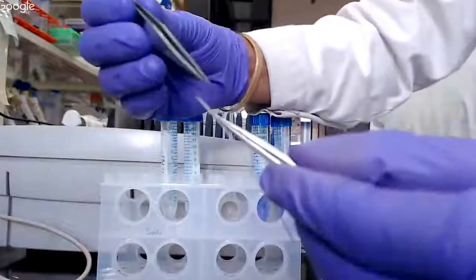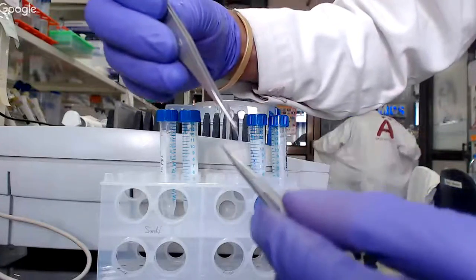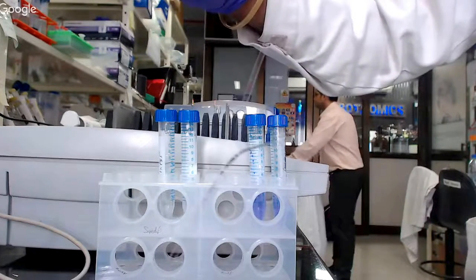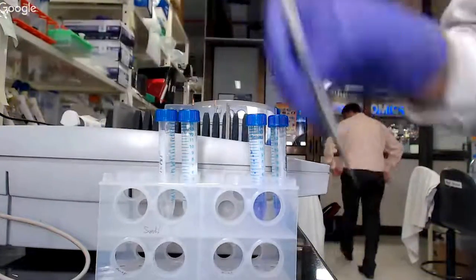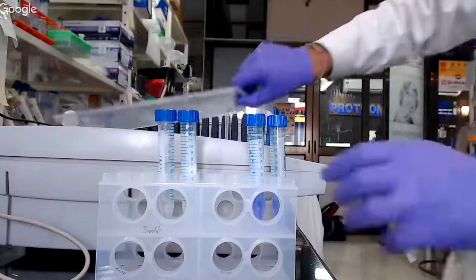Hello students, thank you for being here for this live demo. We will start with the first step, which is rehydration of the IPG strip. As you can see, this is the IPG strip. The IPG strip is usually available commercially with a plastic coating on the gel side to prevent damage. The first step is removal of this plastic film and exposing the gel side. The IPG strip has information about its length and a barcode.